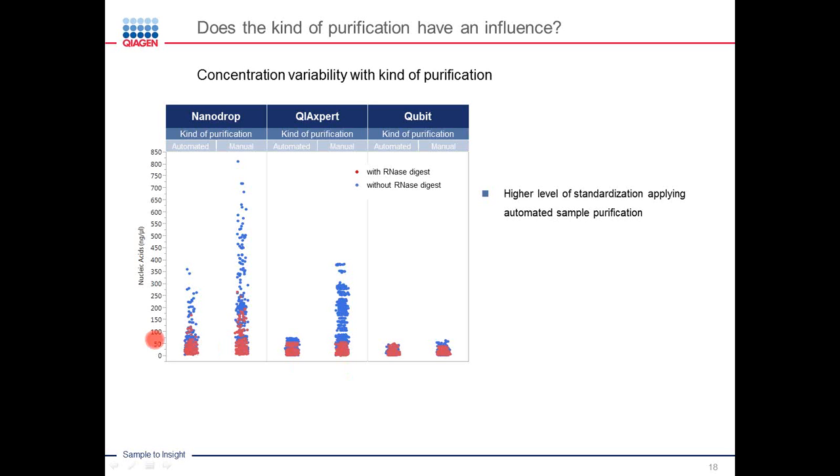So when we split out data points based on that, we're looking at samples that were purified on the QIAcube with an automated procedure versus manually. If you just look at the red data points, because let's forget about the blue ones for now, you can see that overall there are fewer outliers when you process samples in an automated way, and this is very obvious when we measure with a nanodrop here, so fewer outliers, but still some on the nanodrop measurement, versus the manual procedure where we do see a bit more outliers. And what we think this tells us is that using an automated procedure for the purification simply provides a higher degree of standardization and therefore a little improvement on your results, I would say.